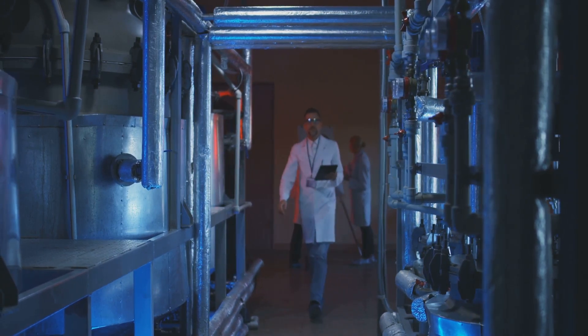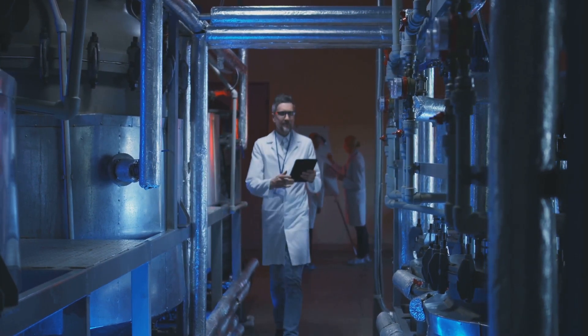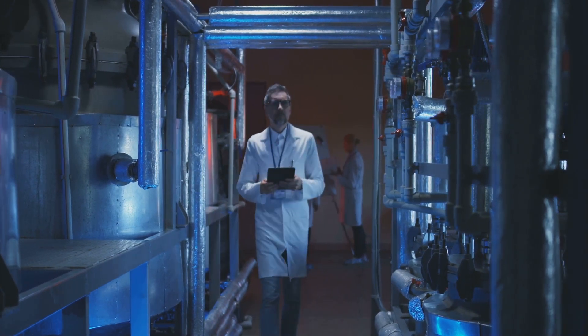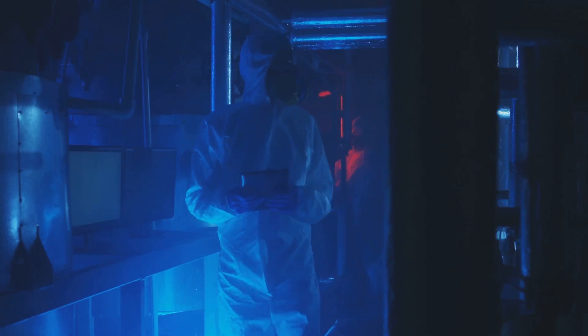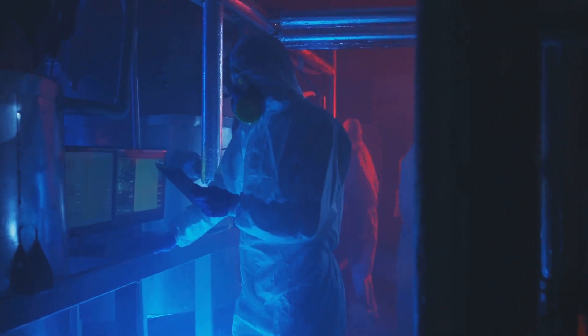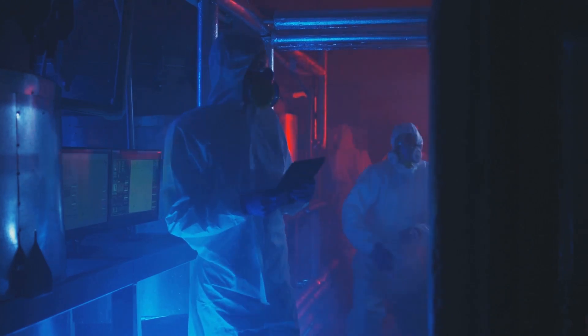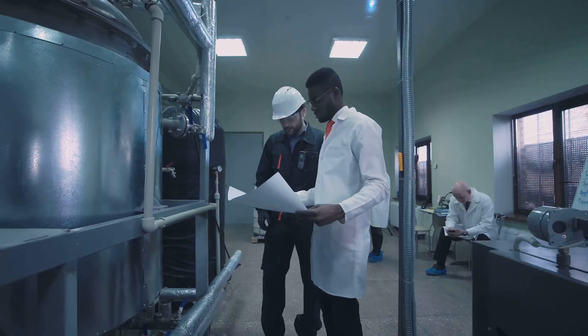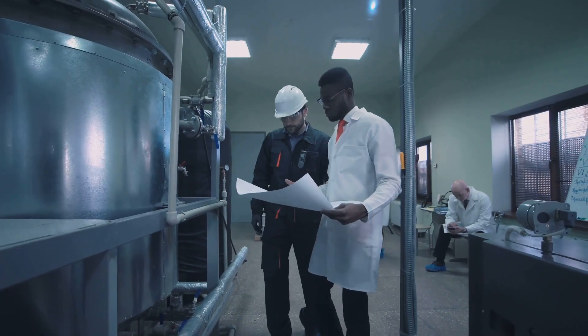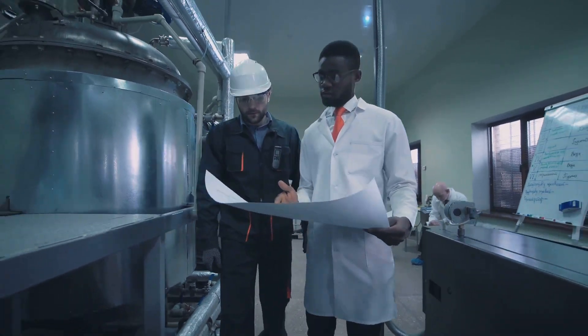Selecting a UV lamp involves finding the right energy level for the VOCs. The 10.6 eV lamp is versatile, while higher energy lamps detect more elusive VOCs. Consider your needs and budget to select the best lamp for accurate readings.